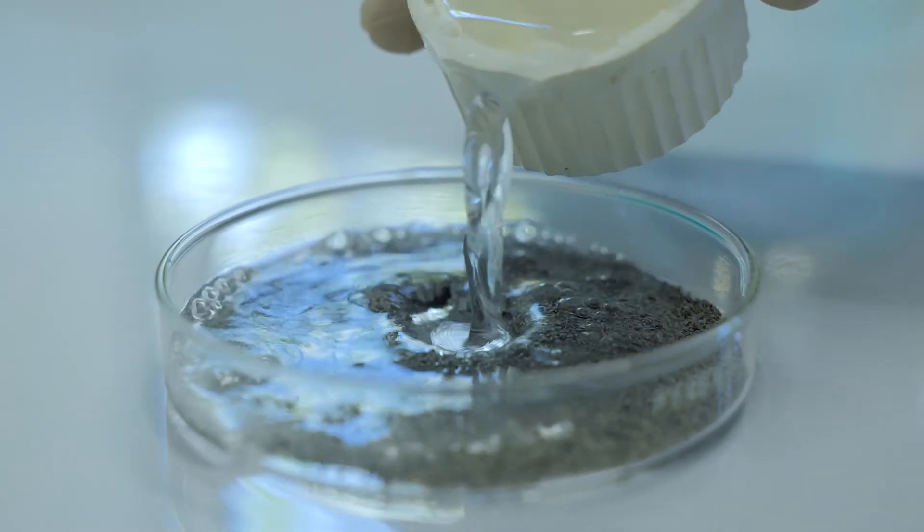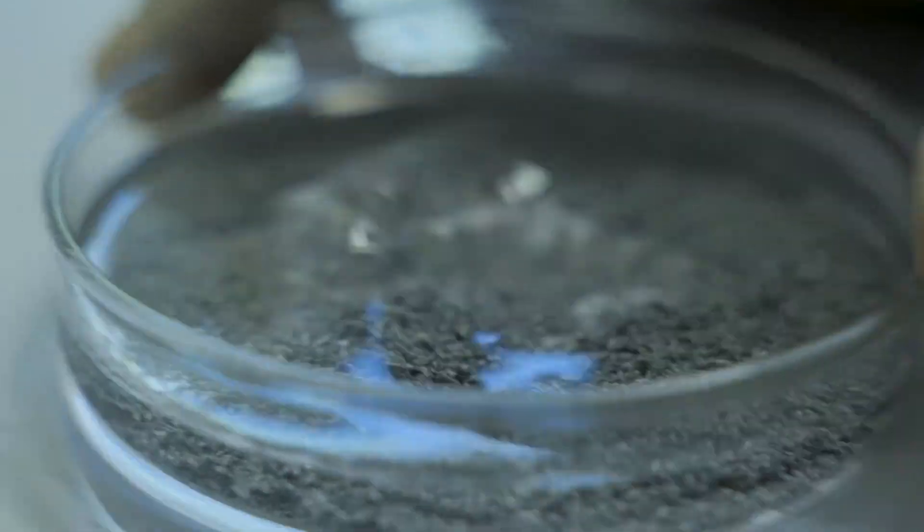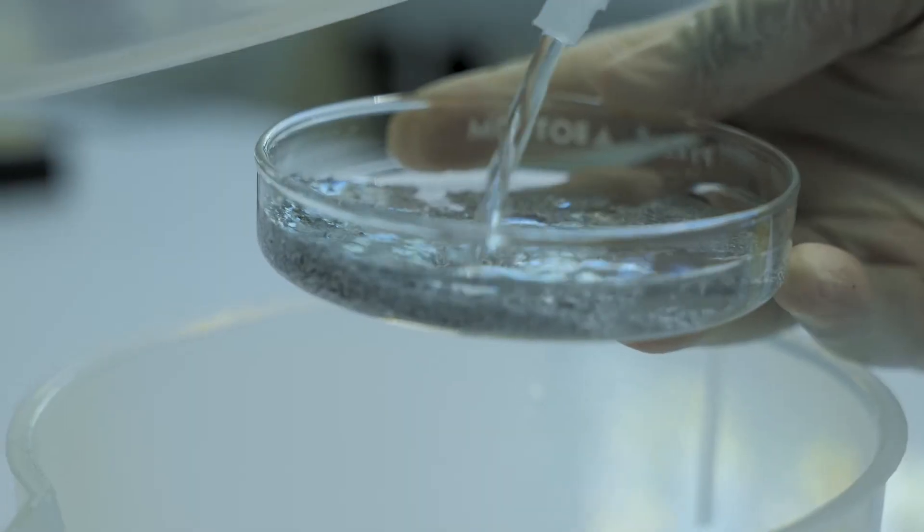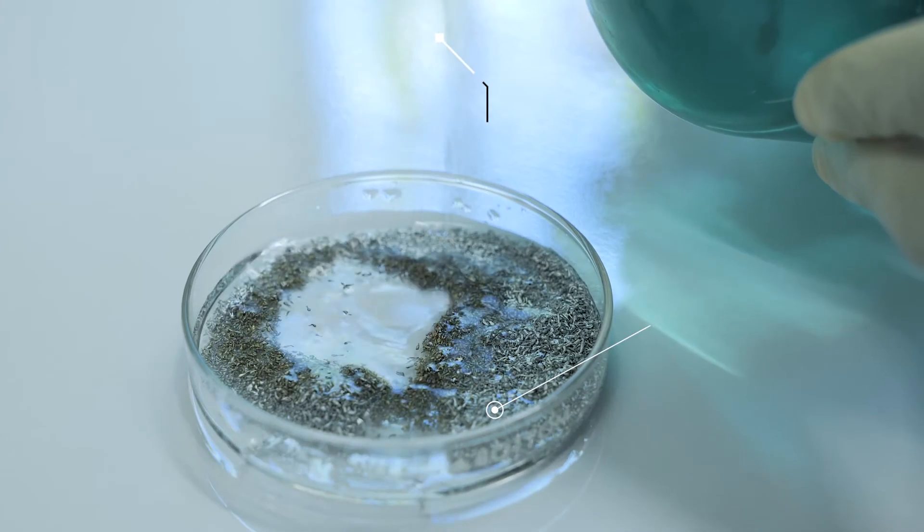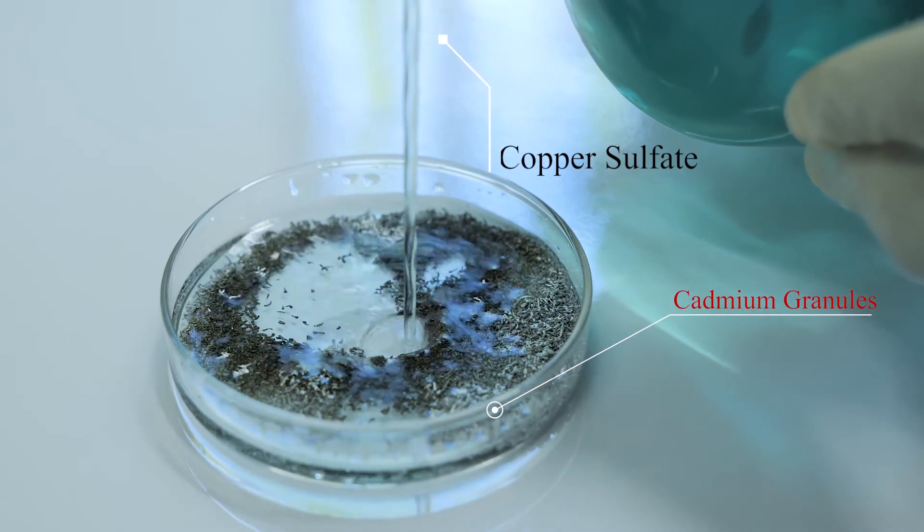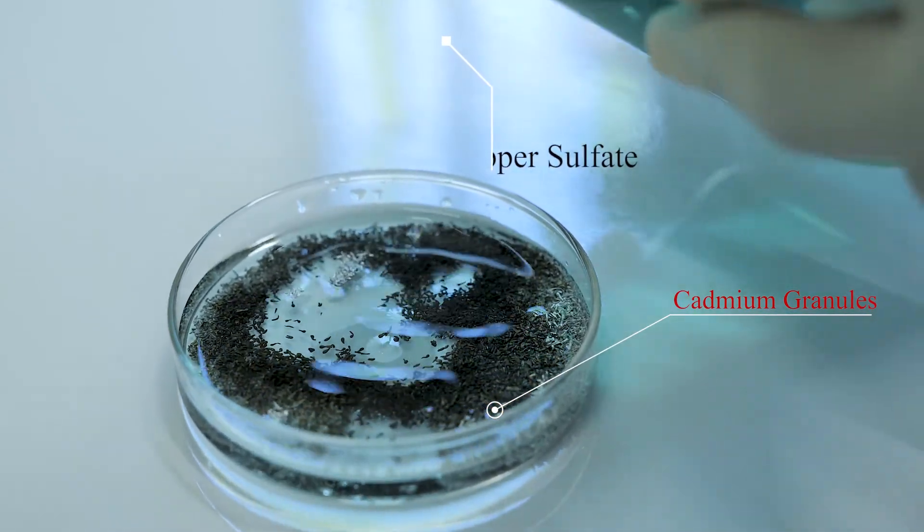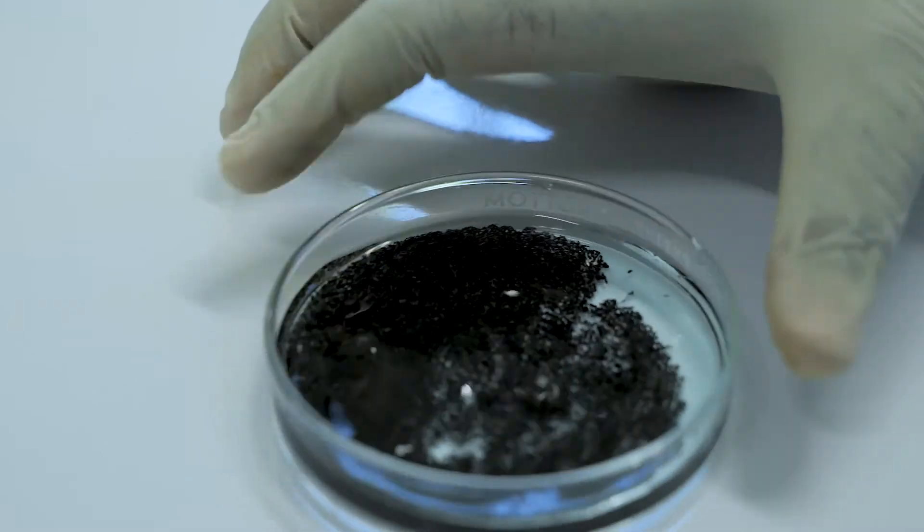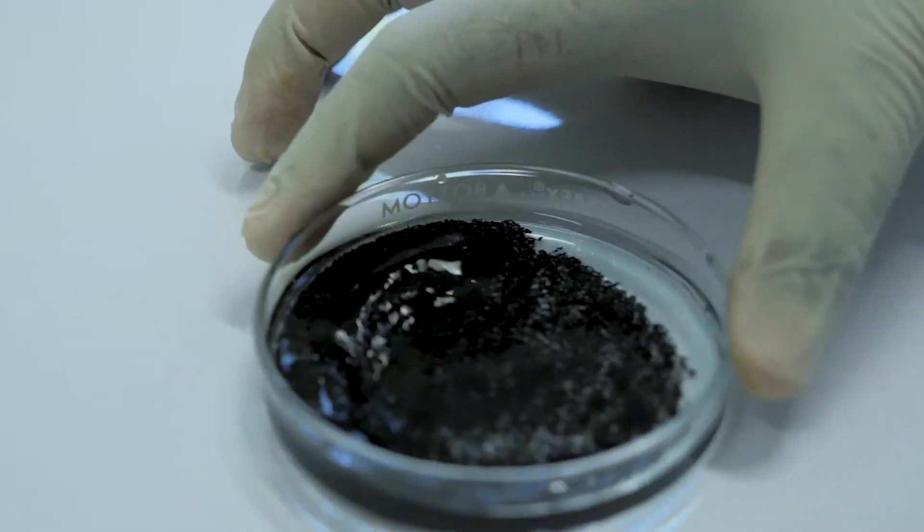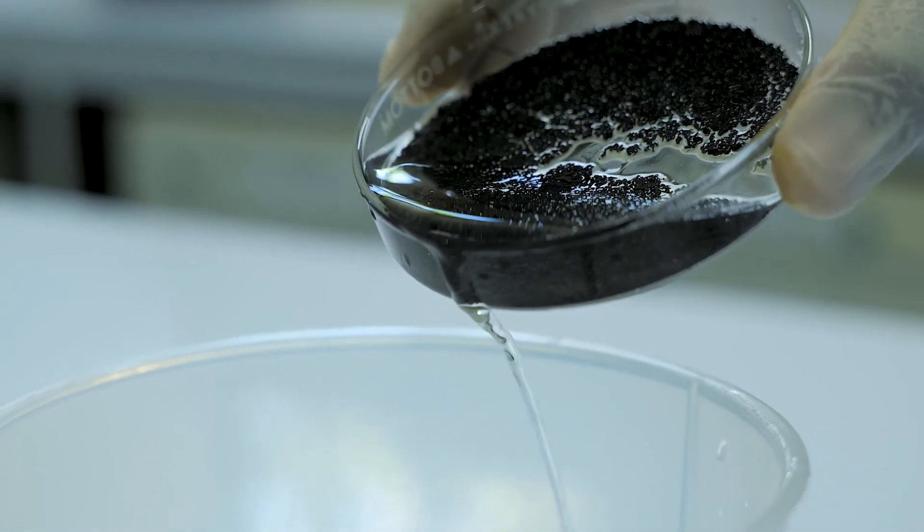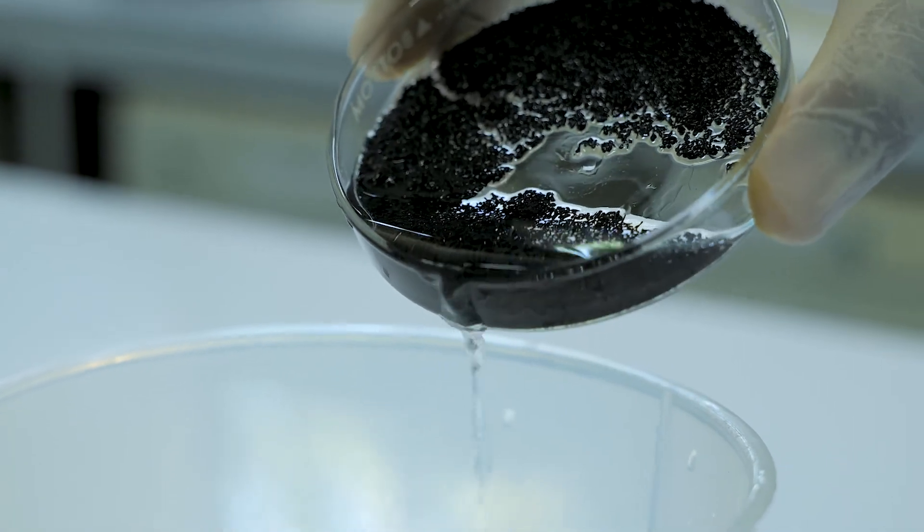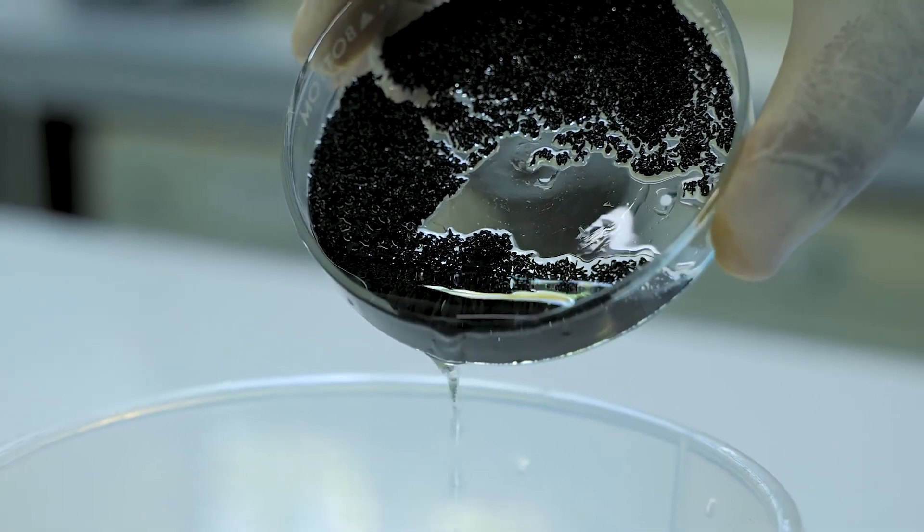Wash 25 grams of cadmium granules with hydrochloric acid and rinse with water. Swirl cadmium with copper sulfate solution for 5 minutes or until a brown colloidal precipitate begins to develop. Gently flush with water to remove all precipitated copper.